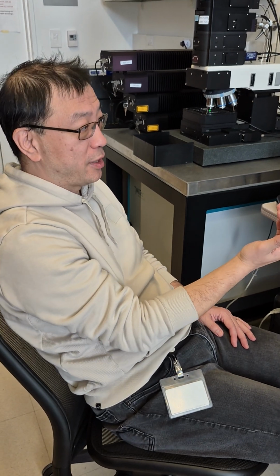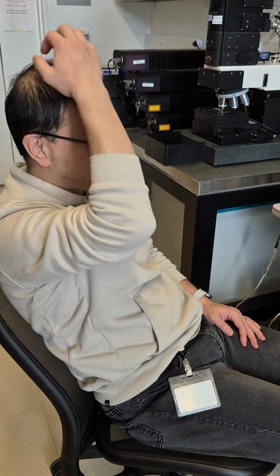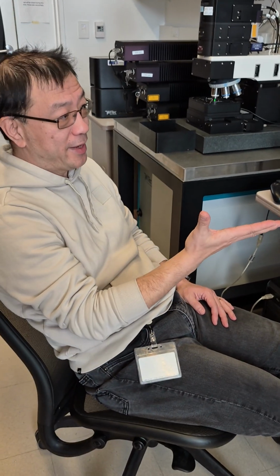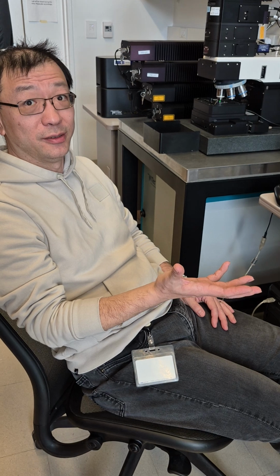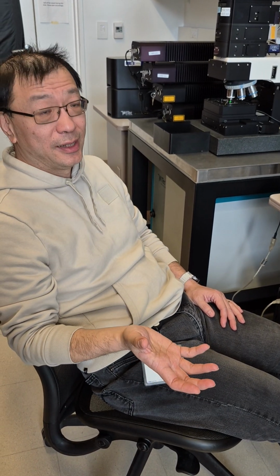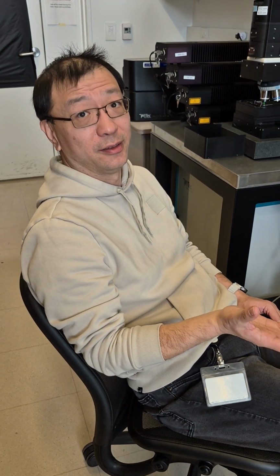And your background is not zero, so you just do a quick calculation yourself. And it's not a sharp cut. You got 99 versus 101, they both are good. Don't be picky. But you got 80, or you got 10, of course, not okay.